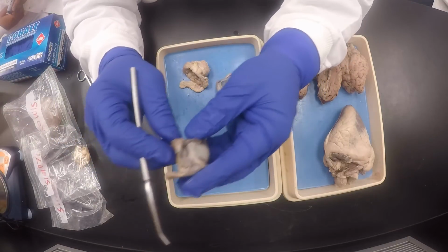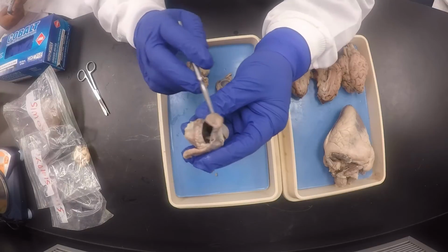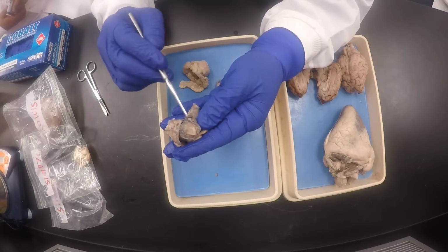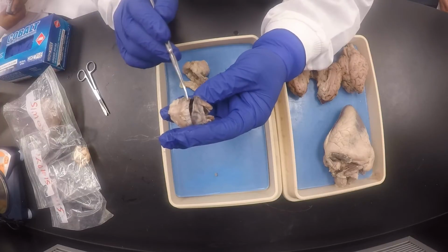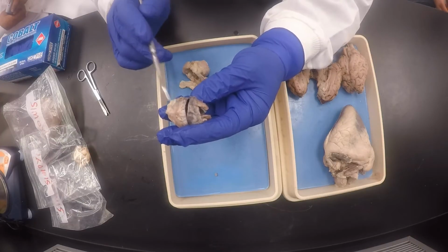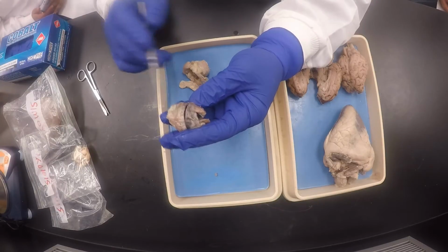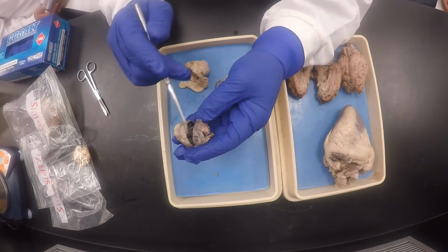Then we make the second incision on the sclera, and I said you scoot all your extrinsic eye muscles to the front, like what I'm doing, and you see how I cut just in front of the retractor bulbi. If you try to cut on the retractor bulbi, you'll be there all day and night because it's hard. So you make sure you snake your way through that.